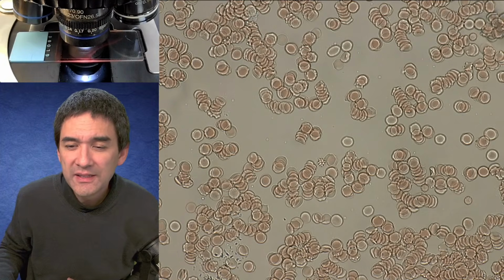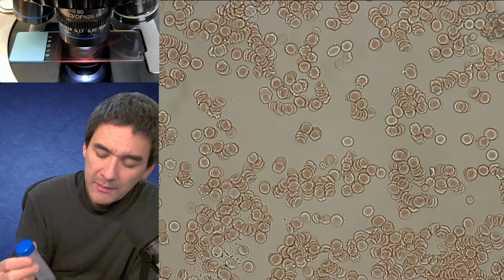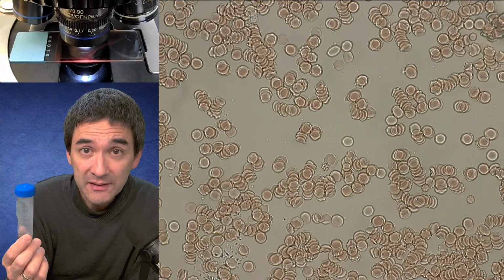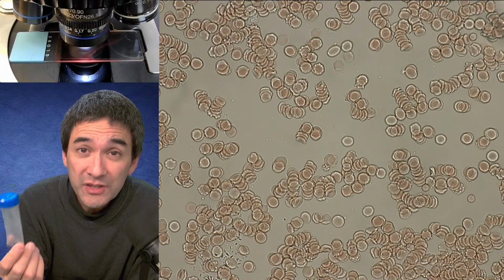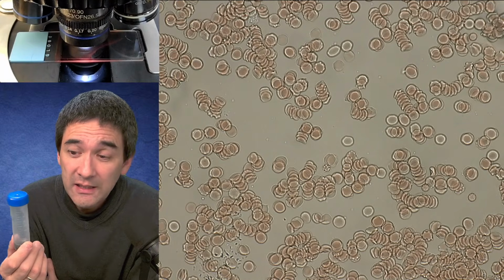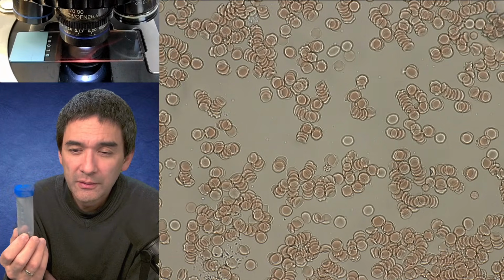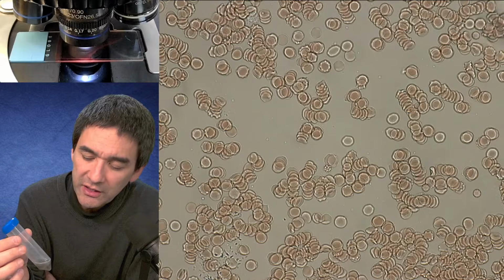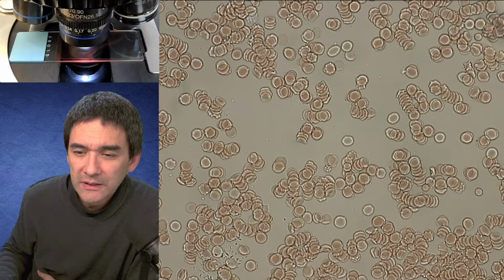Have you added glacial acetic acid to the 35%? No, I have not. What I usually do is the following. After the whole thing has been digested with hydrogen peroxide, I remove the hydrogen peroxide and add some acid, for example, acetic acid, because the acid will dissolve any calcium carbonate which is in there. Anything which is a carbonate will be converted to carbon dioxide gas, and then you ideally have just the pure silica shells left over. This would be the second step, but I found that simply doing some hydrogen peroxide digestion alone also gets you very far. Yeah. So let me move on.